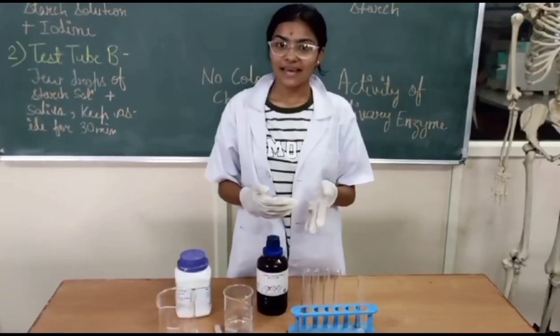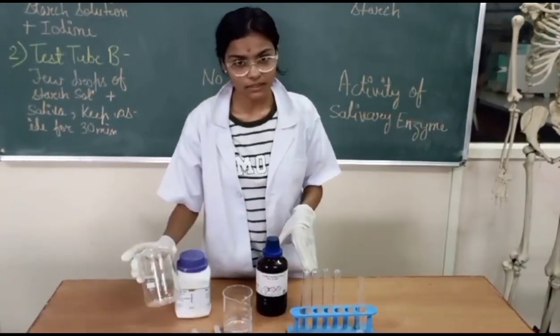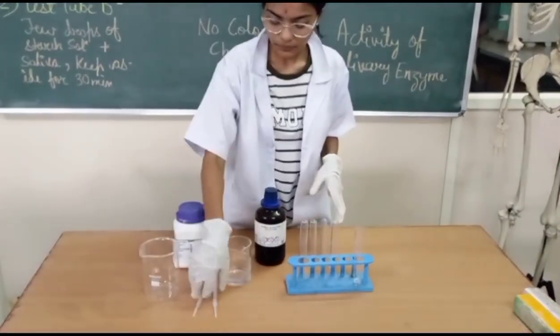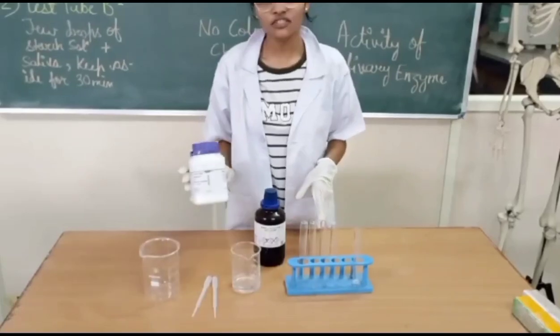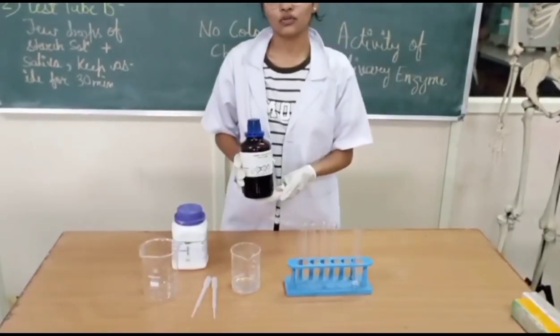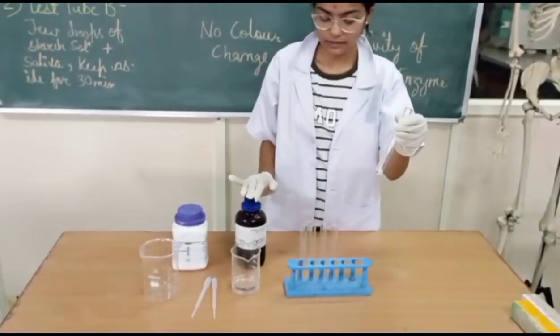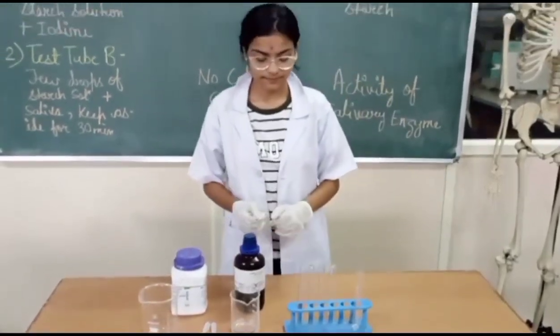For this test, the materials are: beaker, dropper, distilled water, starch soluble, iodine solution, saliva sample, and test tubes.